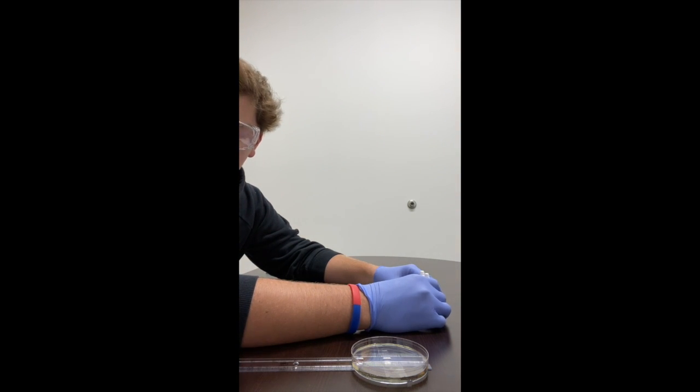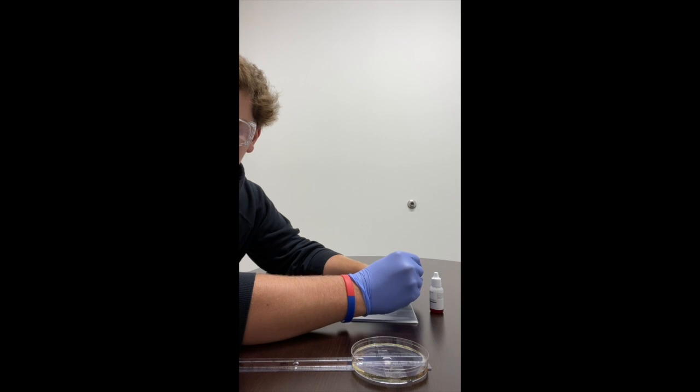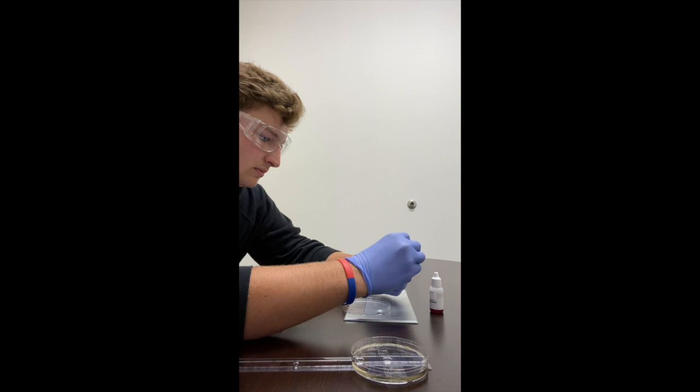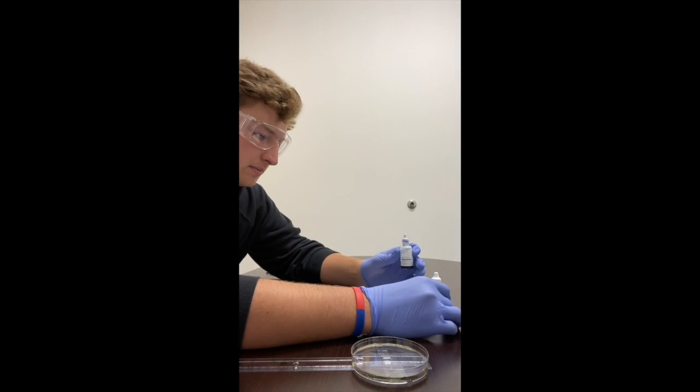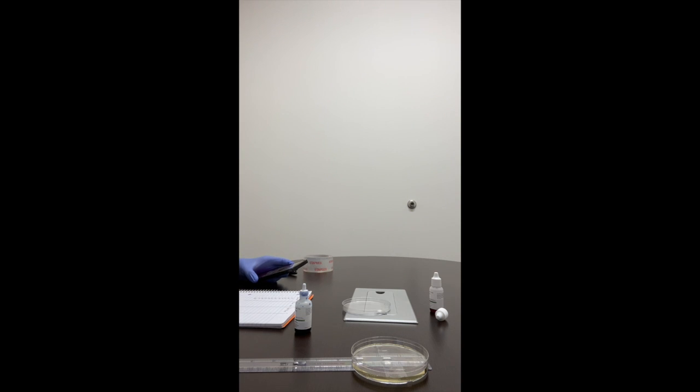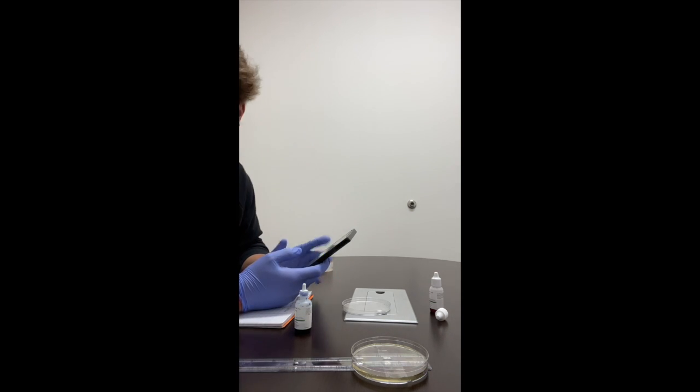Place a single drop of blue dye in the middle of the corn syrup. Note the position where the dye fell by reading the location of its outside edge on the ruler. Okay, record the location of the outside edge of the dye, the distance it has traveled, in millimeters every 10 seconds for a total of 2 minutes.